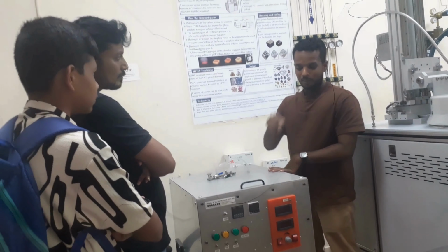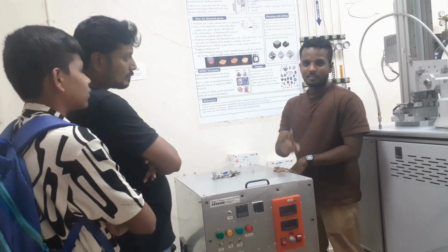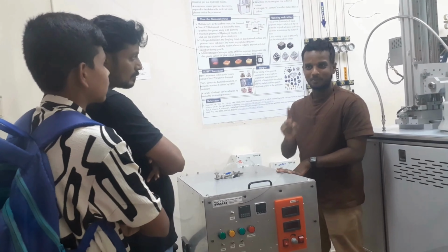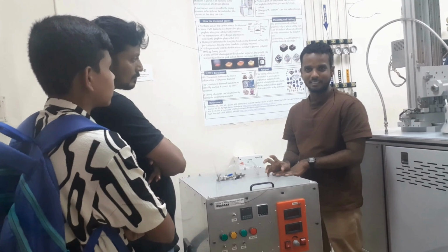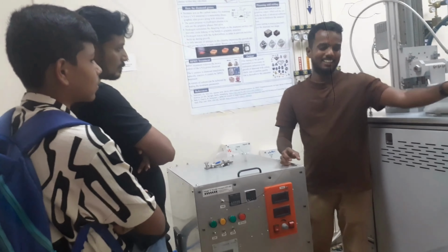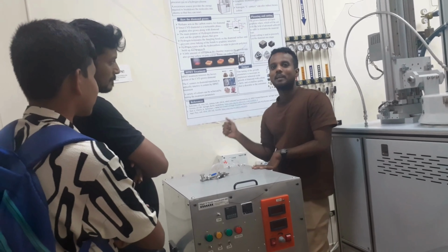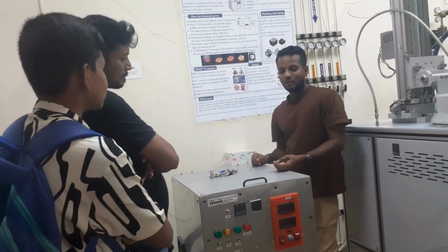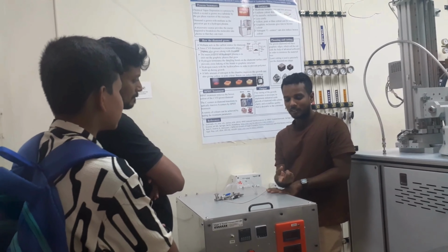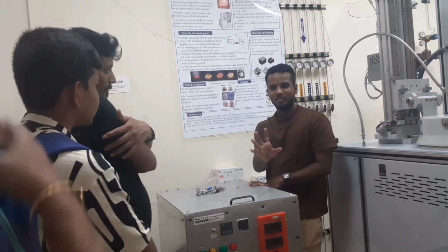If you do all these measurements on one sample, it will cost some 3 lakhs, 4 lakhs. For one sample you have to spend at least 3 to 5 lakhs. Instead of that, we can just buy it. All these studies are for the application part. If it is gem quality, either Raman or UV or IR is enough. For about 1,000 rupees, we can finish all the measurements.